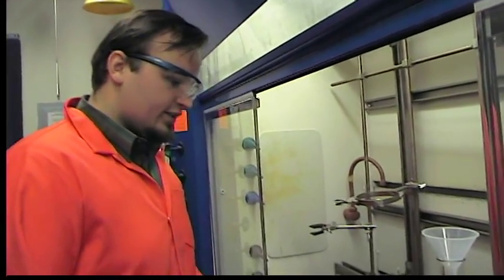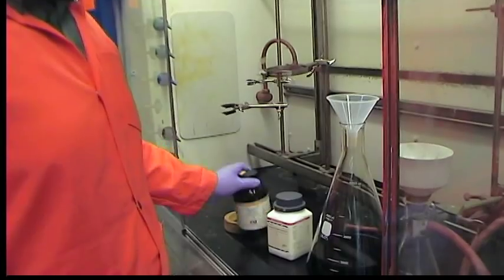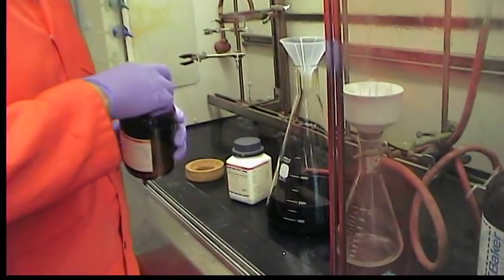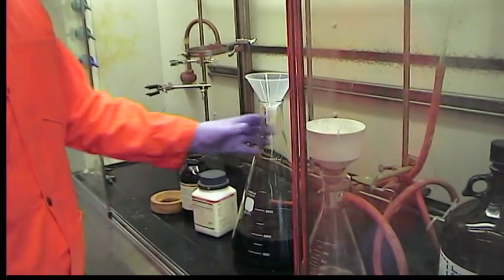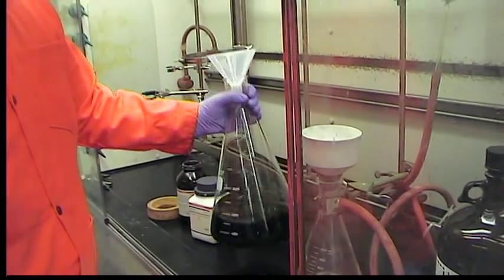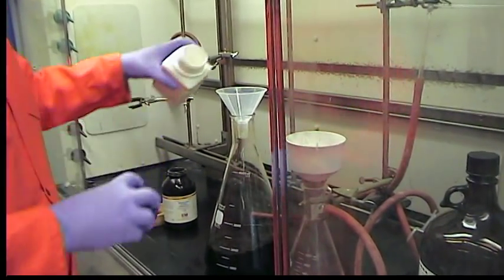We're done with the extraction and we've concentrated the liquid to about three liters. Overnight some of the solvent evaporated further. What we're going to do now with this about two liter flask is we're going to add magnesium sulfate to remove the last traces of water.